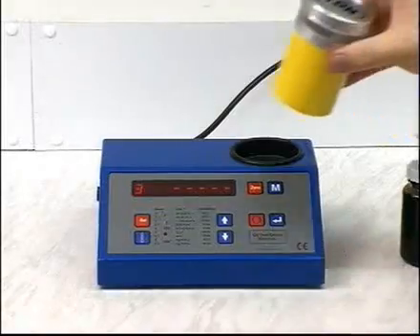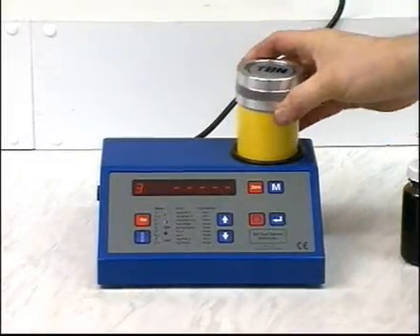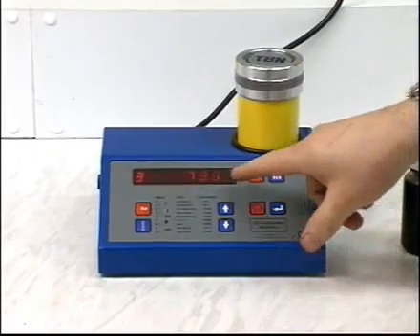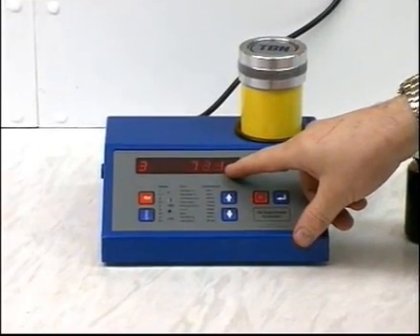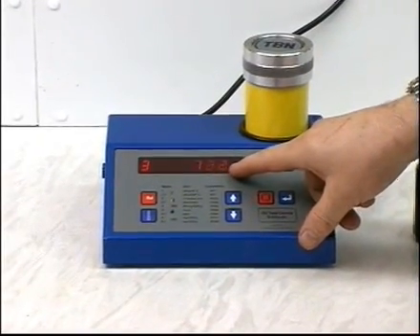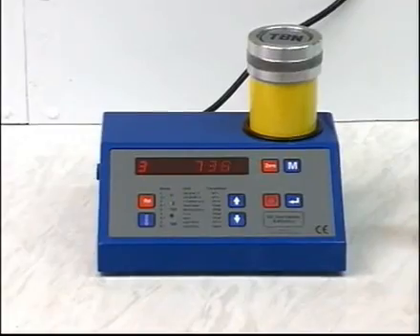To test for TBN depletion in used oil, repeat the procedure just outlined, replacing the new oil with an equal amount of used oil. The figure displayed on the unit at the end of the procedure is the test value, which will be used for calculating TBN depletion.